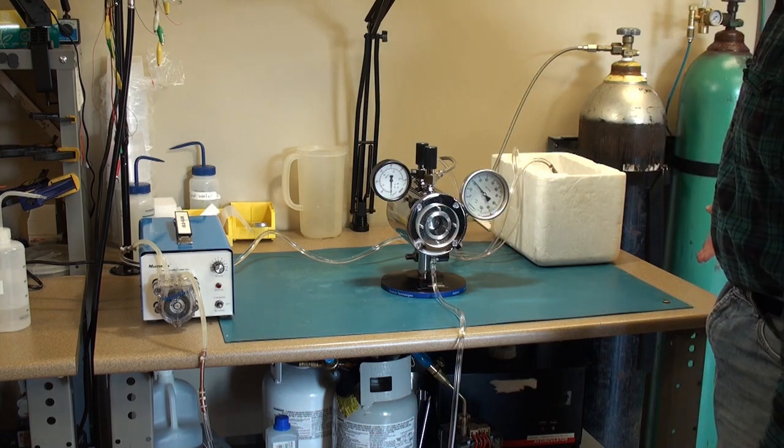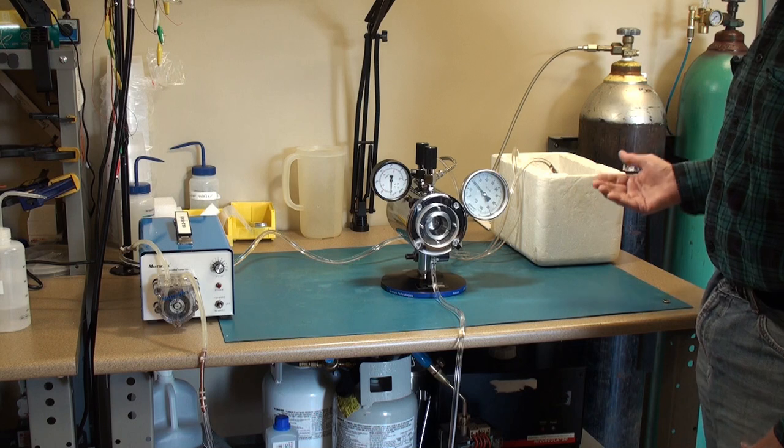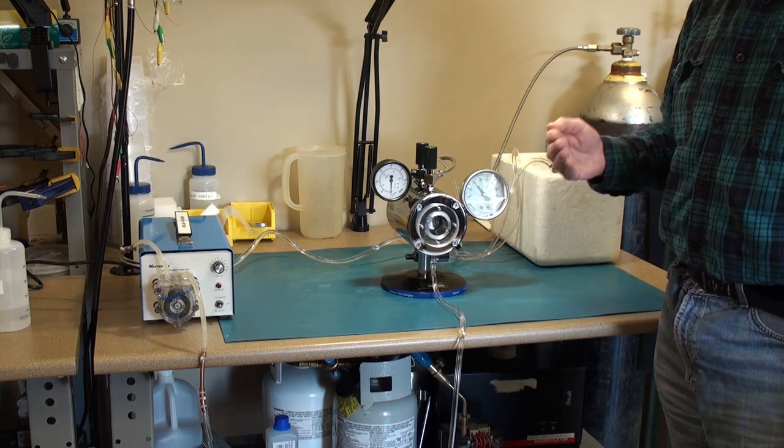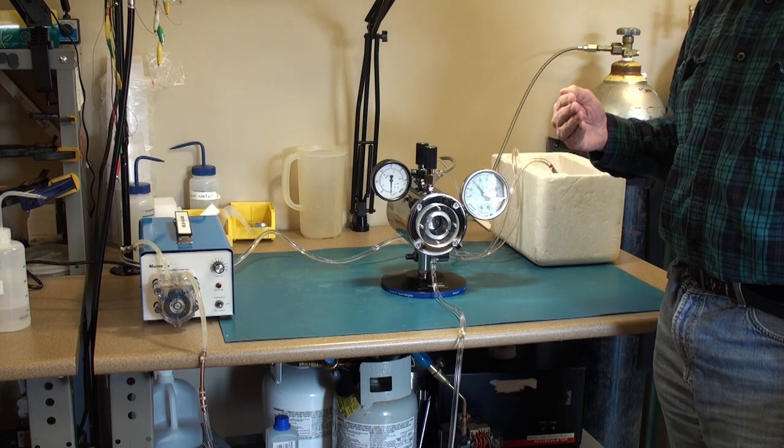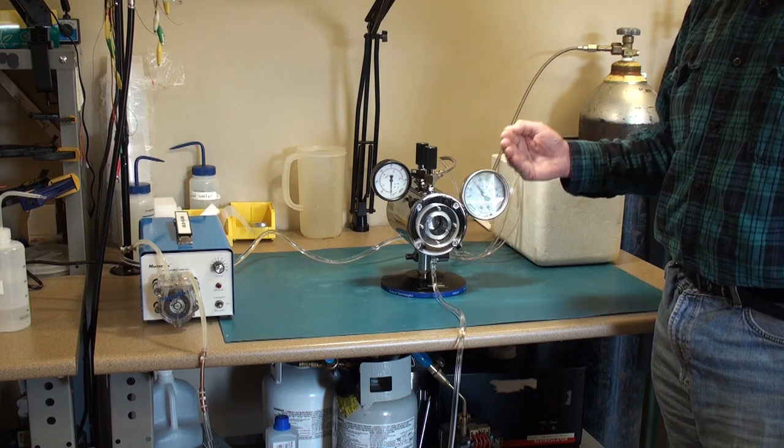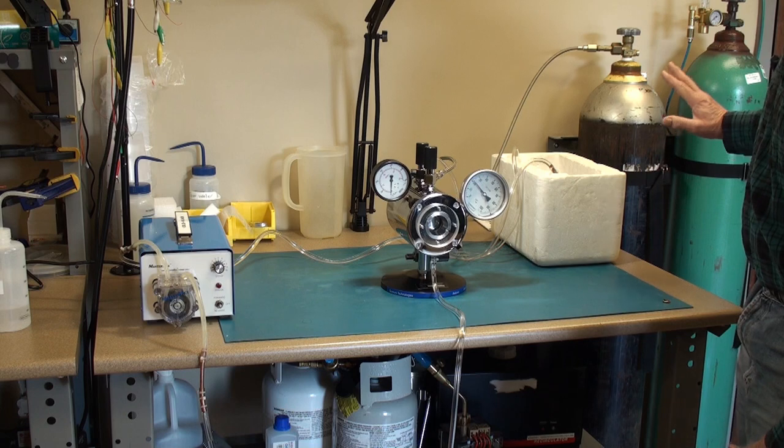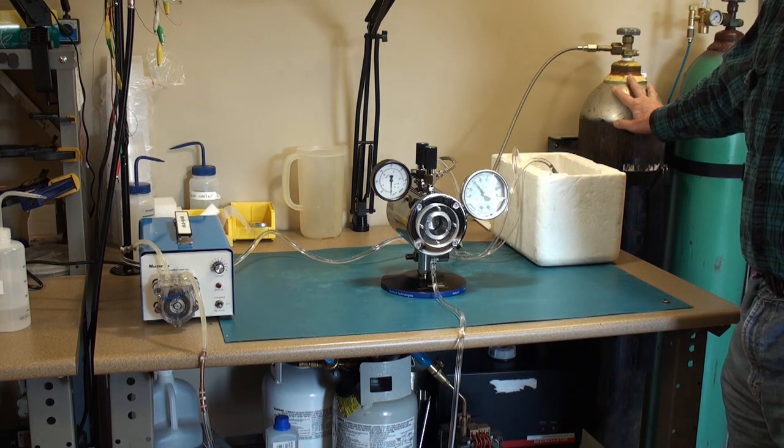And then you take and you compare the weight now to the weight full. In this way you can have an idea how much CO2 is left in your tank and how many processes you can run on one cylinder of liquid CO2. Also the gas companies don't take the best of care with the tanks.